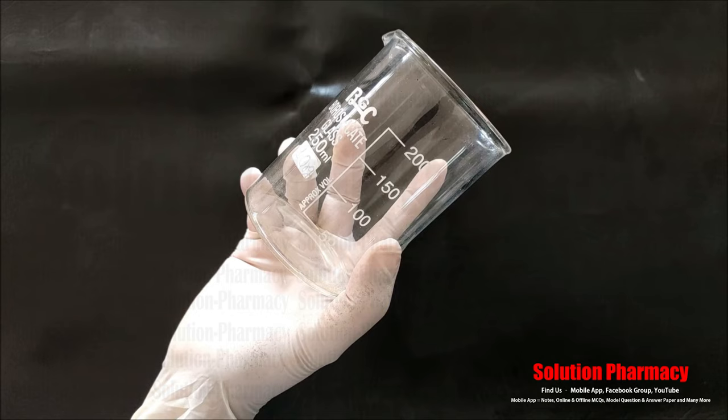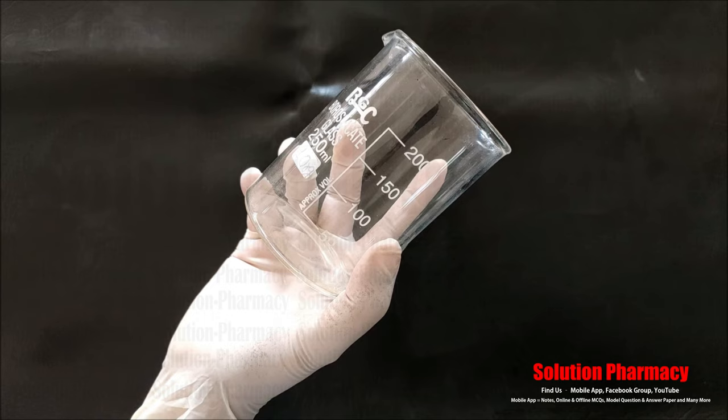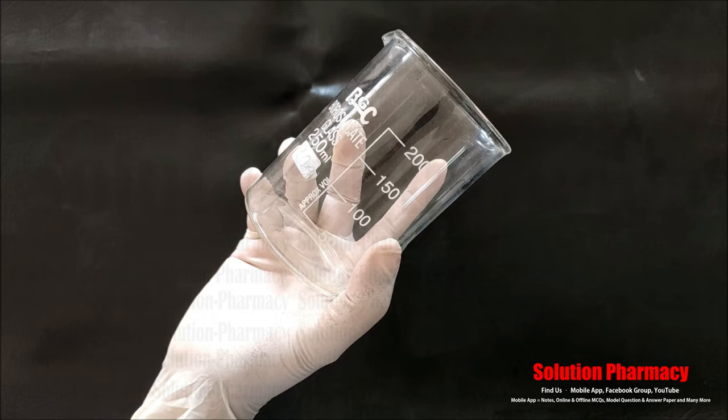Hello friends, welcome to the channel Solution. Today's video we will tell you about different types of glasswares which are commonly used in all laboratories for different practical work, research and analysis. Glasswares are made of glass — either soda lime glass or borosilicate glass. So let's start.